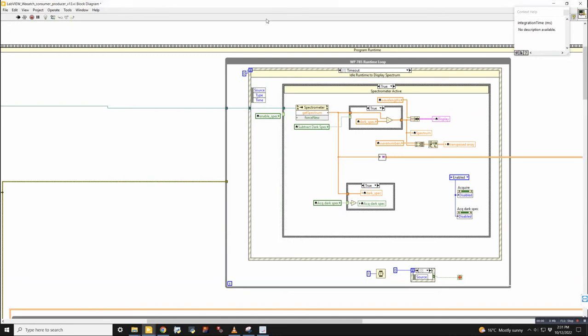Is that just because LabVIEW likes to make its arrays in this way, right? Not this way. Is that why?